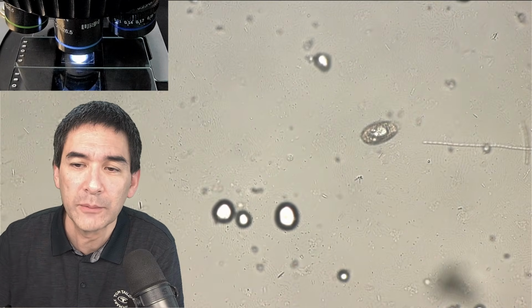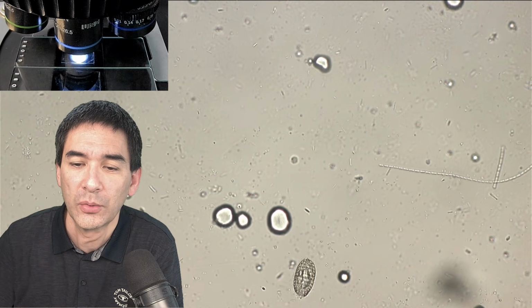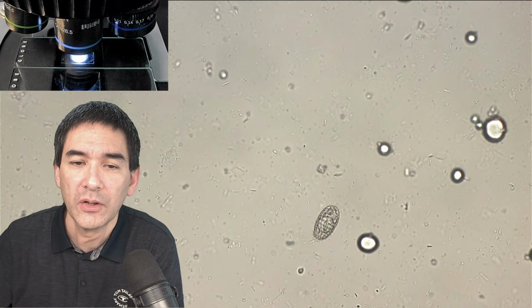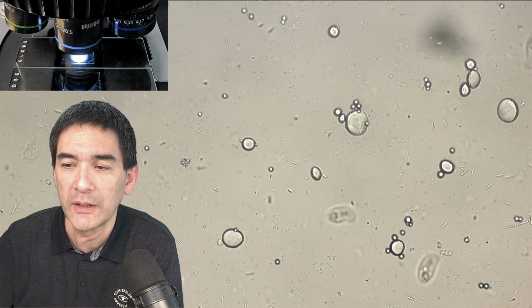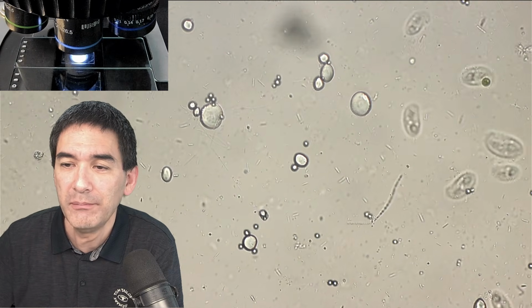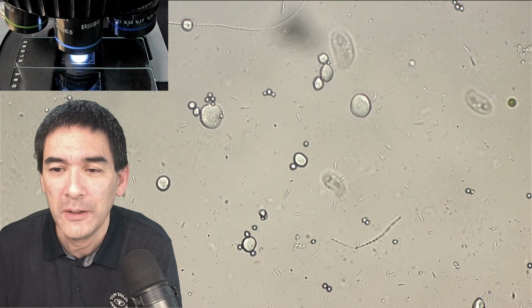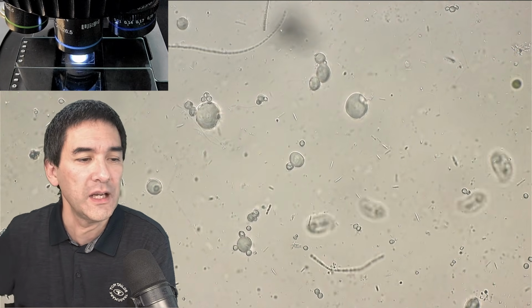So again, this is now regular bright field, and sometimes you can also see some of the vacuoles and other cell organelles that they have. Yeah. So very small in the background, of course, a little bit of biology. Of course, I also would like to explain to you, because maybe some of my students are also going to be watching this video. So for this reason, I'm going to turn on, of course, the arrow.